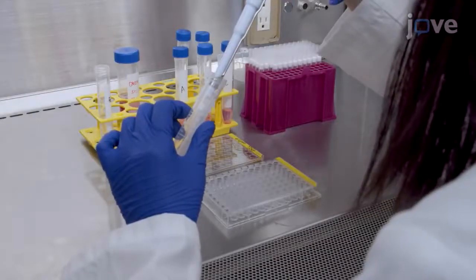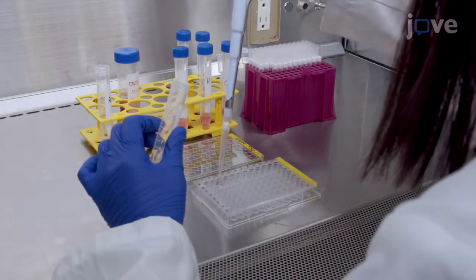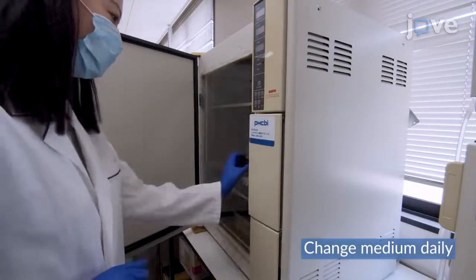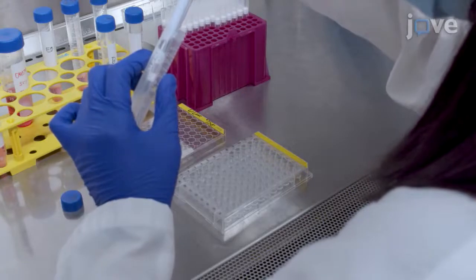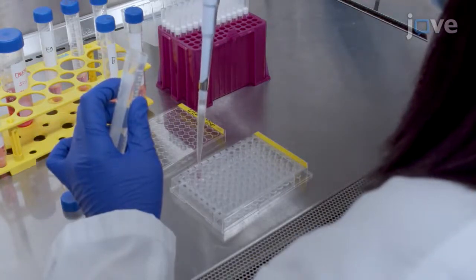After 24 hours, replace the supernatants with 200 microliters of iPS growth medium per well, and return the plate to the cell culture incubator for an additional 2 to 3 days. When the cells reach 70 to 80% confluency, replace the medium in each well with 200 microliters of pre-warmed differentiation medium A, and return the plate.